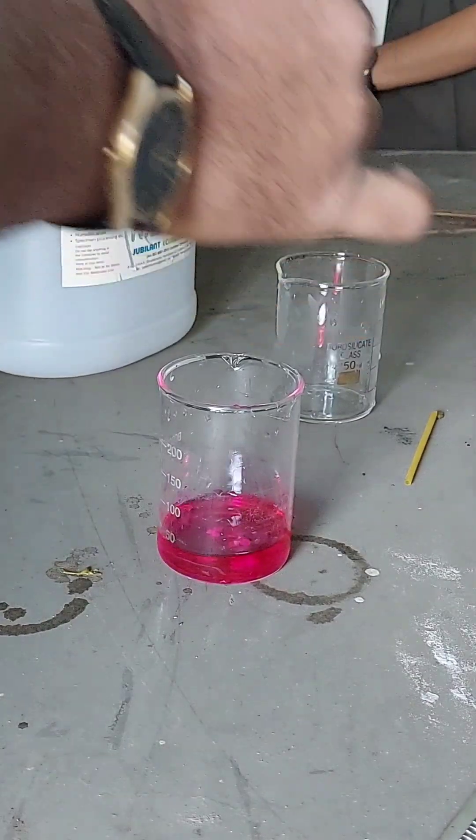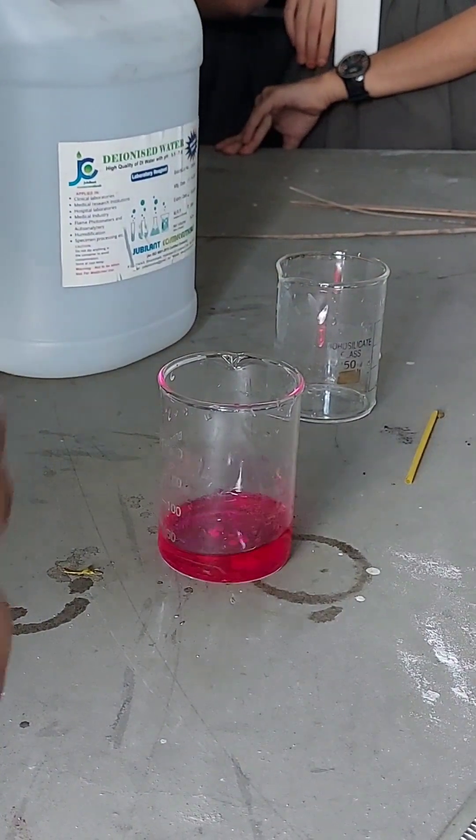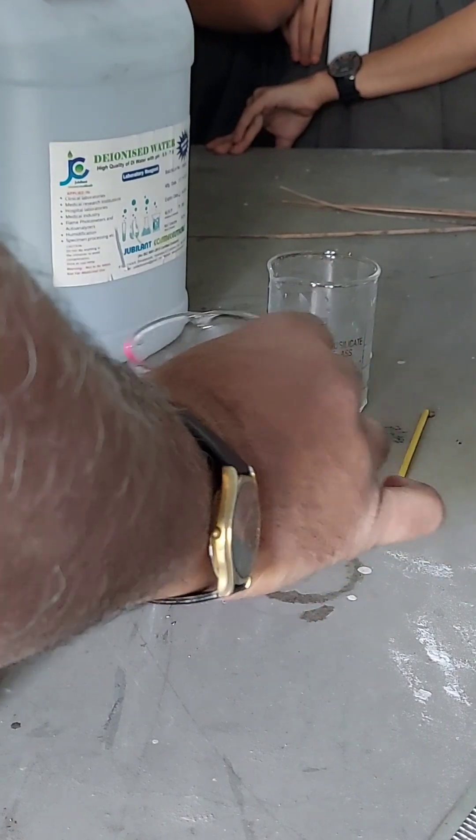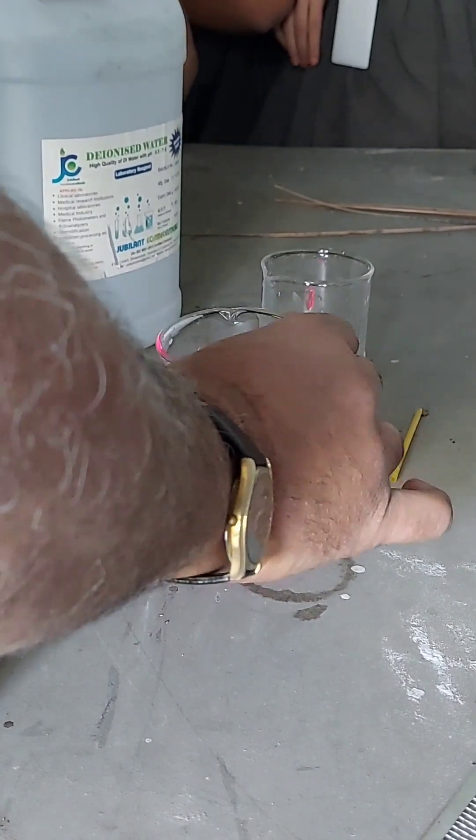See this. It will be pink. So it is a base. Now it has changed to pink. Now it is basic.